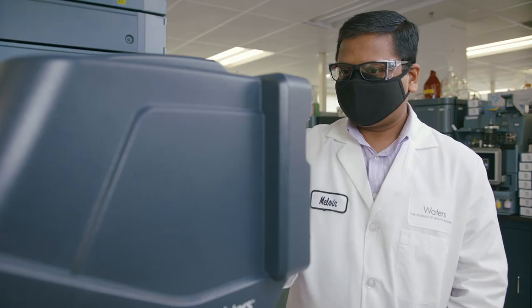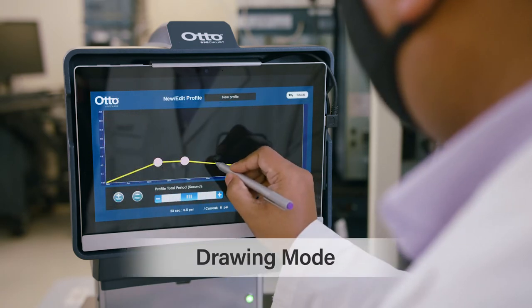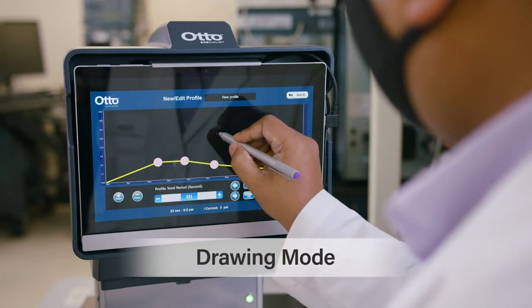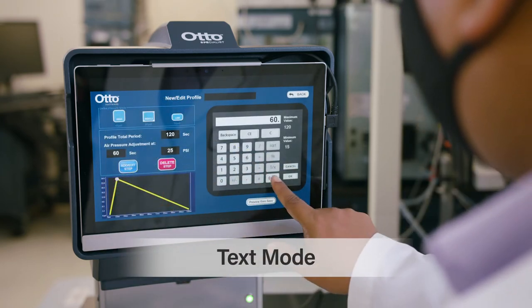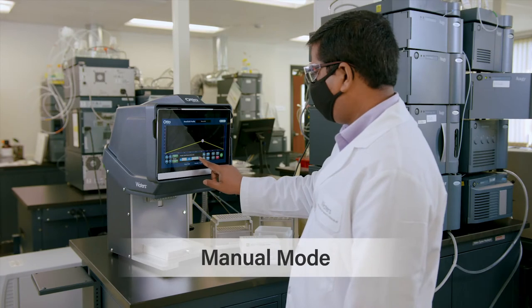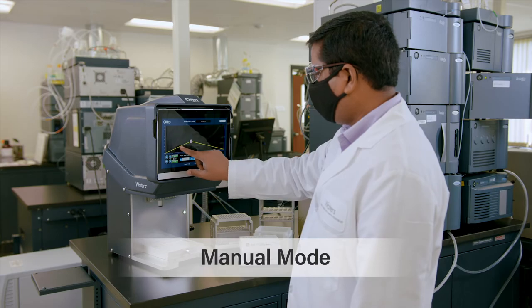To create a pressure profile, select your preferred programming mode. In Drawing mode, you can create pressure profiles by drawing the gradient with the stylus. In Text mode, input the time and pressure in a table format. In Manual mode, increase and decrease the pressure in real-time as you would with the Positive Pressure 96 processor.